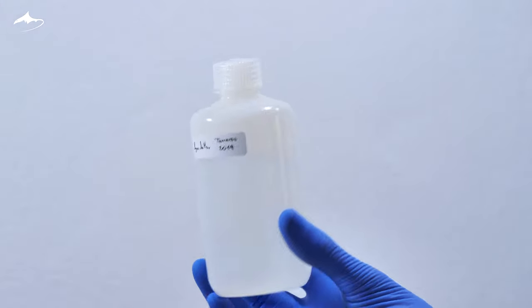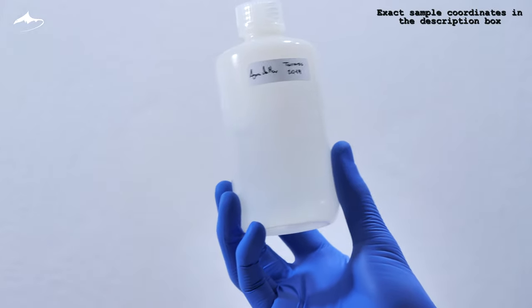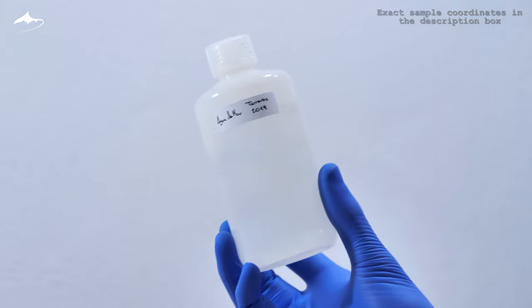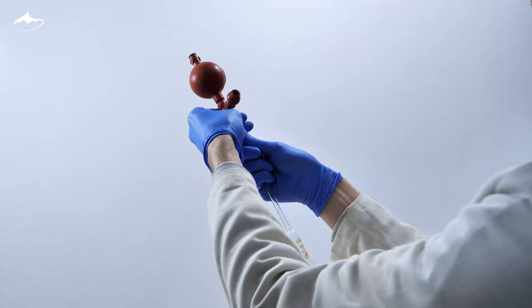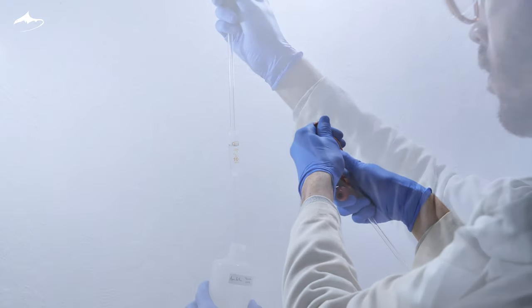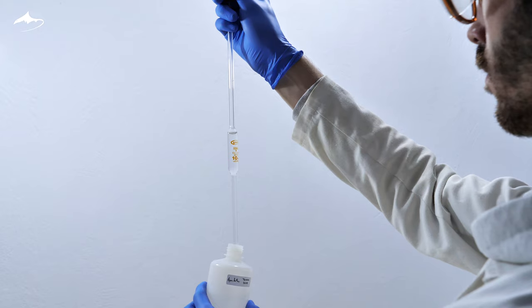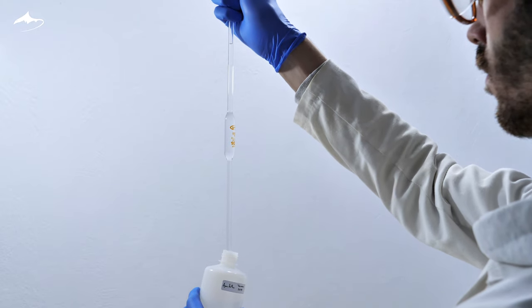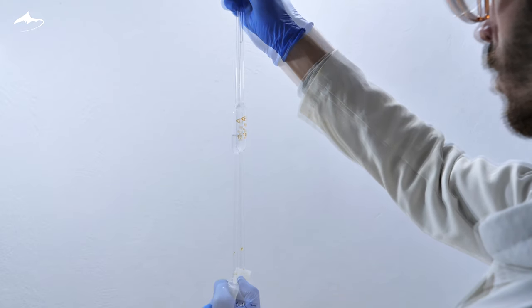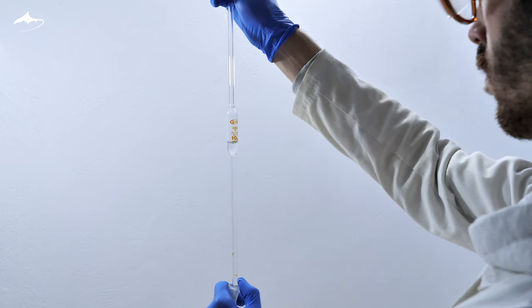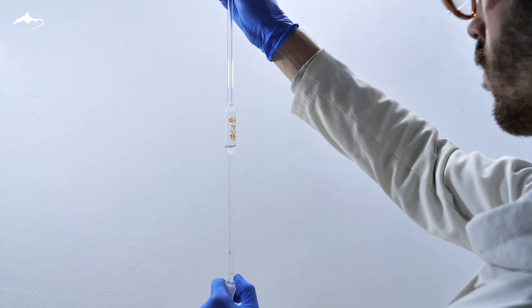Finally, the sample. It was gravity filtered prior to storage. The sample must be diluted, as it is too concentrated for this method. To do this, I transfer 10 ml of the sample with a volumetric pipette into a 100 ml volumetric flask. I consider using the volumetric pipette an art by itself. I like to stand while holding it at high level.